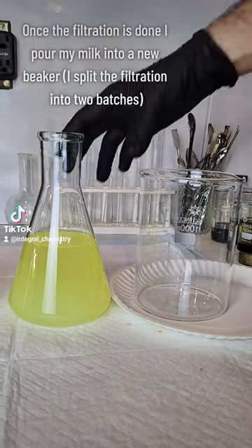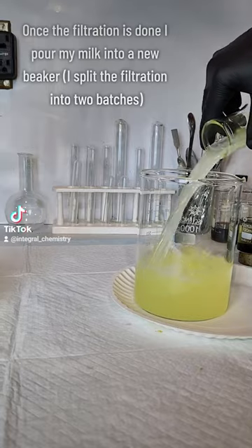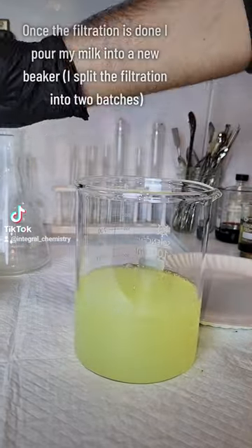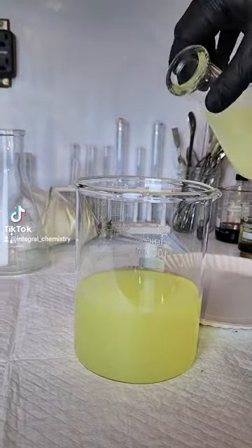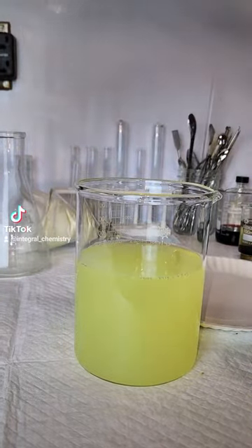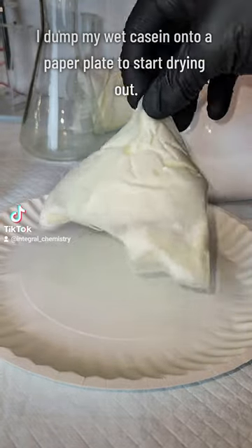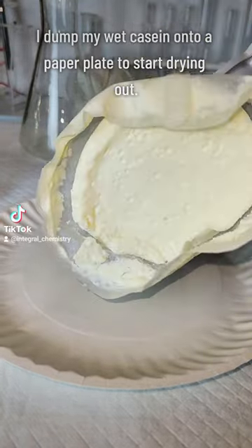Once the casein is coagulated, I filter it off and I'm left with this yellow liquid, which is the real color of milk. It already looks a lot less appetizing, but don't worry, it'll get a good deal worse. I next need to extract whey, but before I do that, I dump my casein out onto a paper plate to start drying it out.